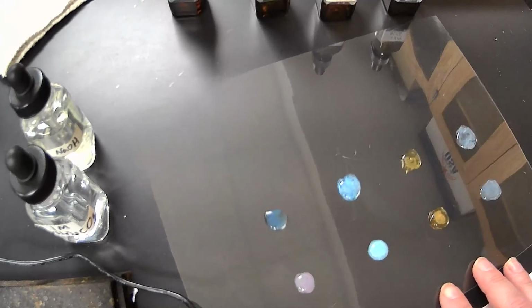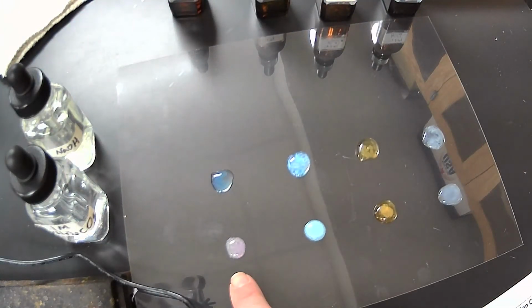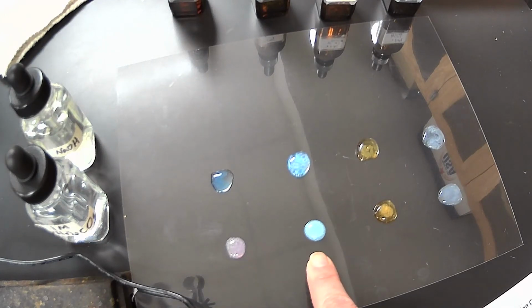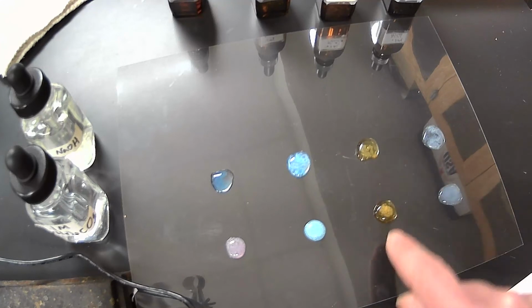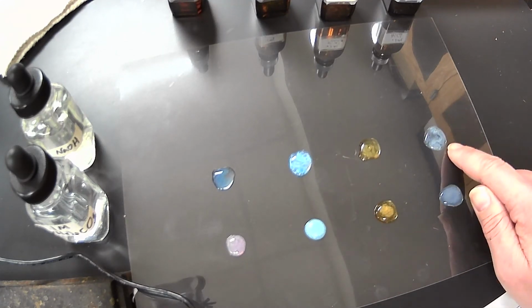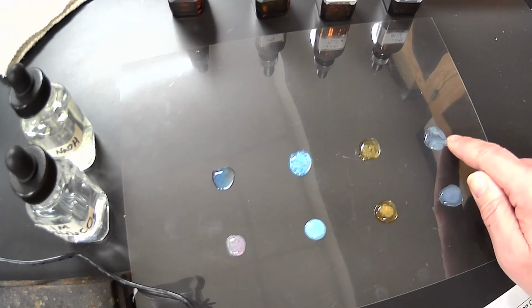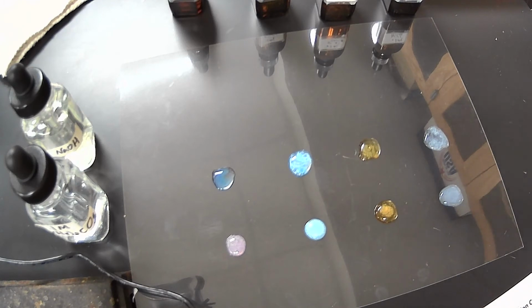There we go. So now we have kind of a nicer look. So you can see the precipitates. This is with the cobalt 2 chloride. This second column is our copper 2 chloride. We can see the cloudiness in each of these for the iron 3 chloride. That indicates a precipitate has been formed. And then with our nickel 2 chloride, it is a little bit lighter, but we can see that white or very light green precipitate that has occurred with that.